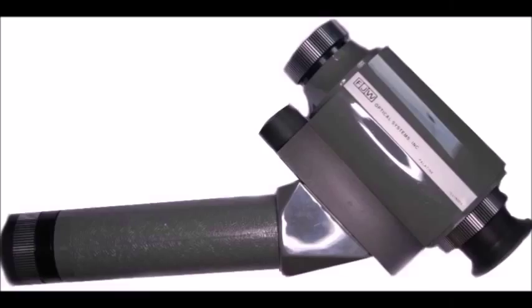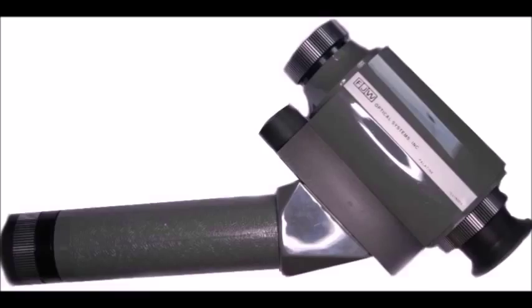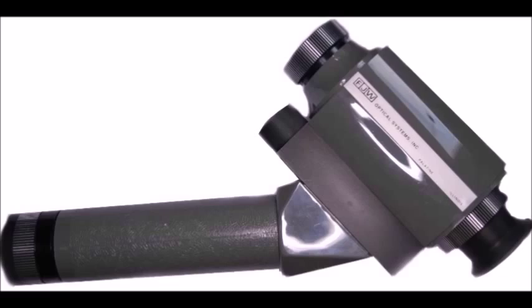We use optical microscopes — what you might call a standard microscope. It has what's called a boom arm, which allows us to hold the lens or eyepiece over the document rather than close, so it gives a better view. We also have IR and UV scopes that allow us to use ultraviolet light and infrared light to look at a document.